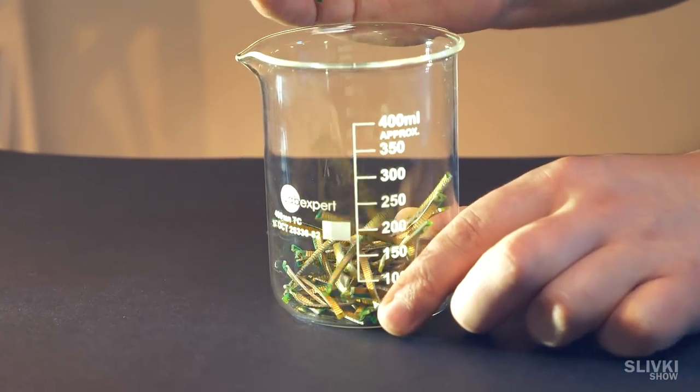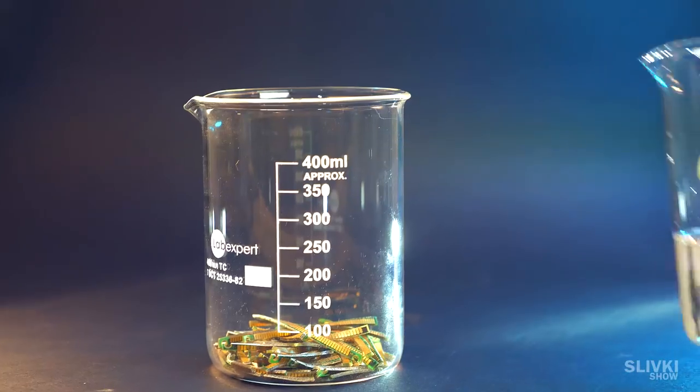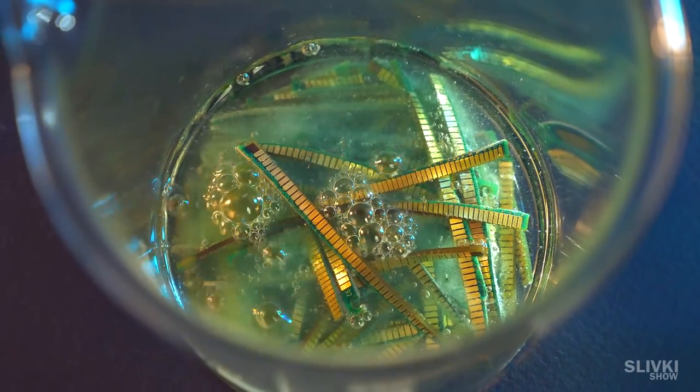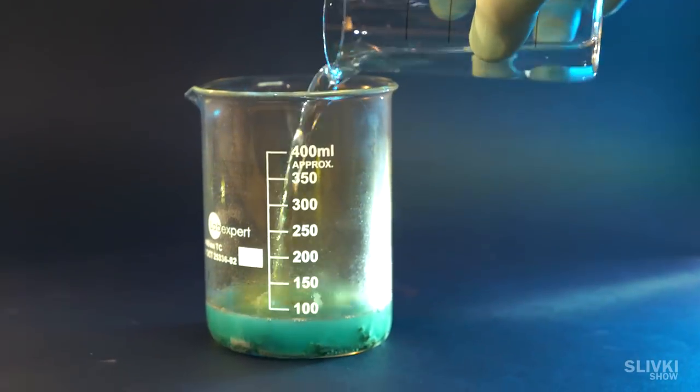Pour all of this into deep glass and put nitric acid. In order to make a reaction less brown, we pour more water.